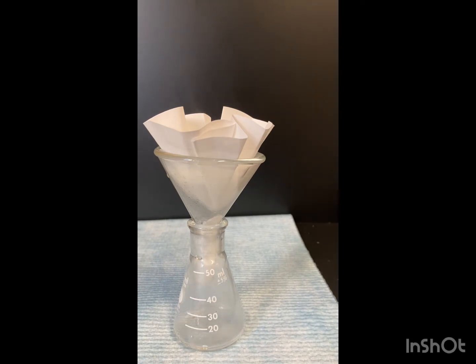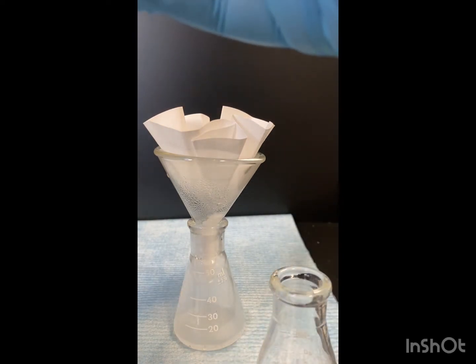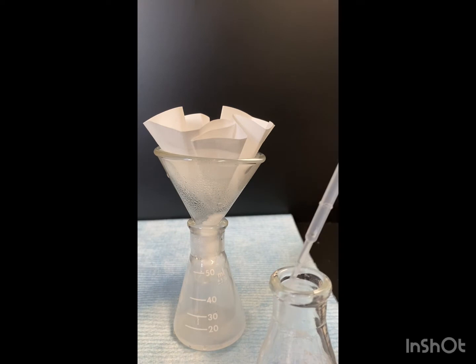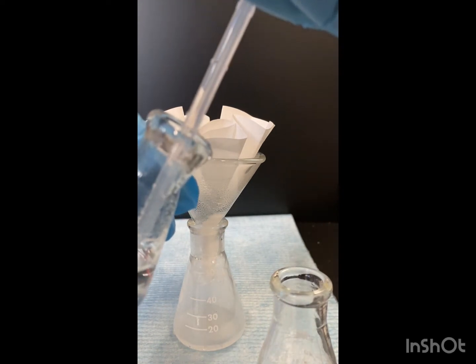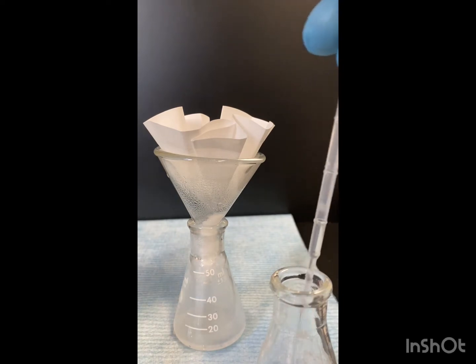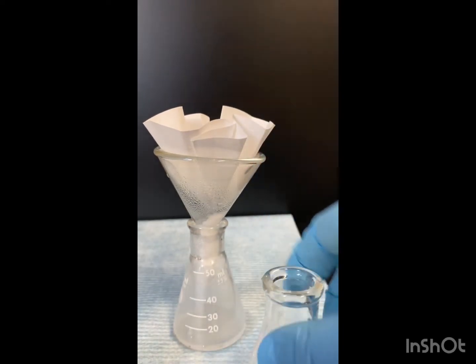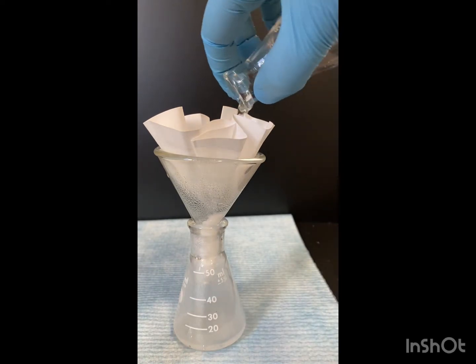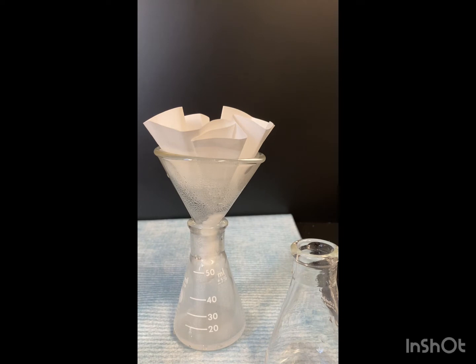Now we're going to take our warm water that we heated up and just rinse. And then we're going to let this sit and cool until room temperature.